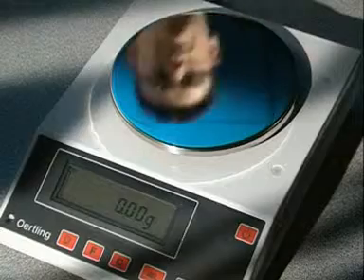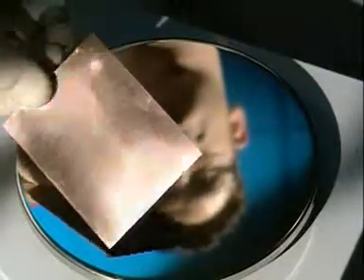But at the negative electrode, the copper is beginning to change in appearance. To find out what's happening, we first need to weigh a new set of electrodes.